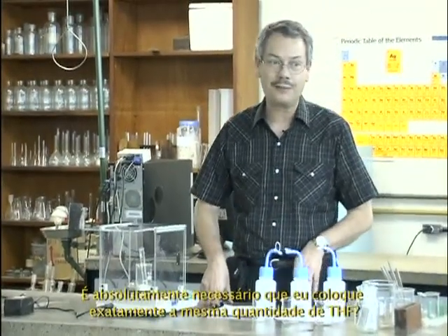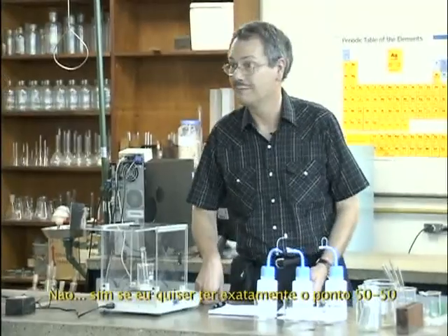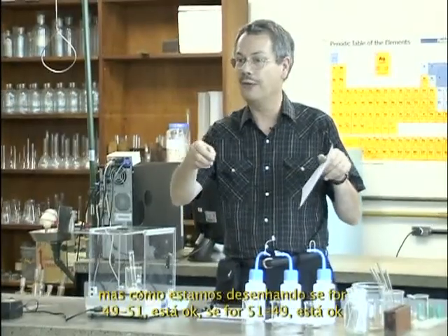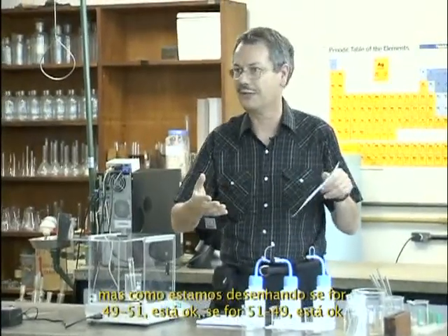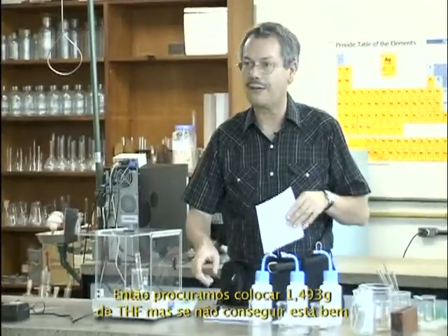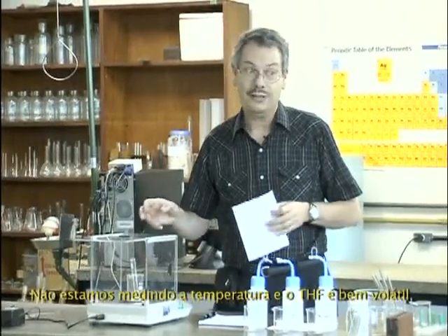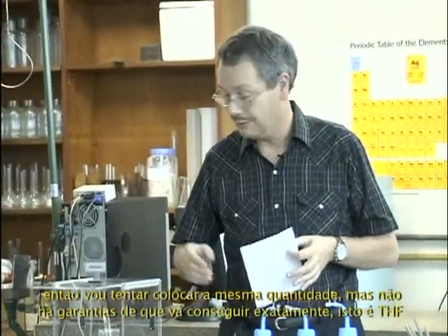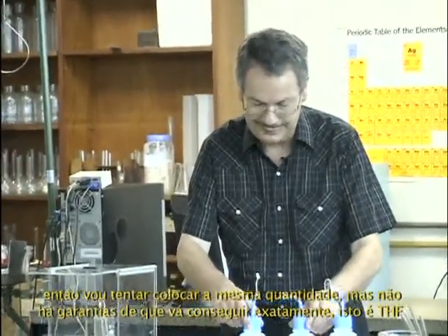Is it absolutely required to put exactly the same amount? No. Yes, it's required if I want to do exactly 50-50, but since you are drawing it, if it's 49-51, it's okay. If it's 51-49, it's okay. So you try to put about 1.493 gram of THF, but if it's not exactly that, it's okay. It will not be exactly that due to temperature, and THF is very volatile. So I'll try to put this amount, but I have no guarantee that I will get exactly this amount.